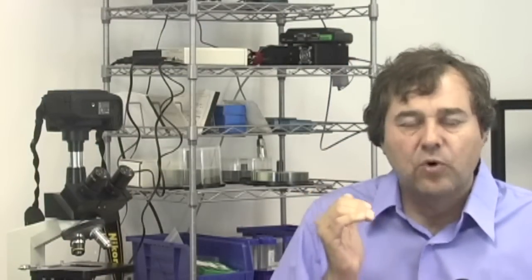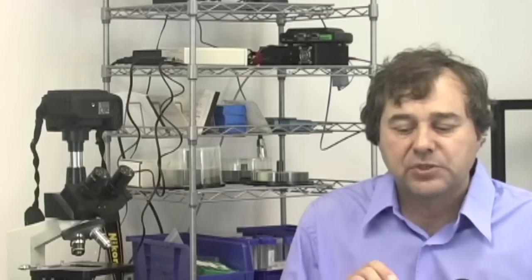There's three things we want to accomplish in this video segment. We want to develop a methodology for orienting ourselves in the Z space so that we can always have the microscope properly tuned to the specimen layer. Second, we want to develop a procedure for searching the slide in an economical fashion. And finally, we want to develop a methodology for determining the coordinates of things that we find under the microscope so that we can note those in our laboratory notebook and go back to those same areas in the future.